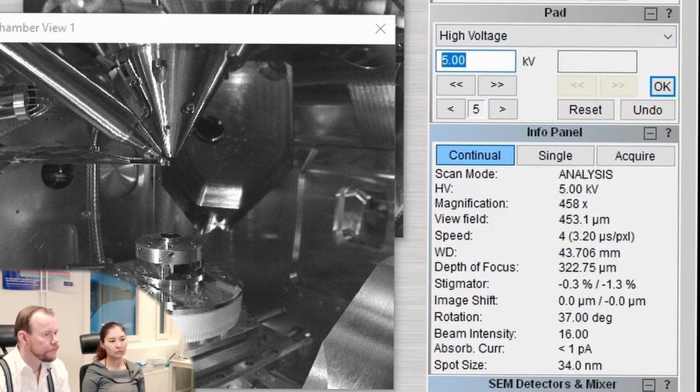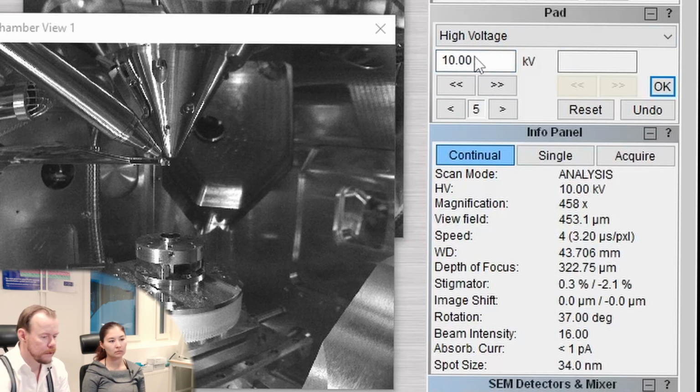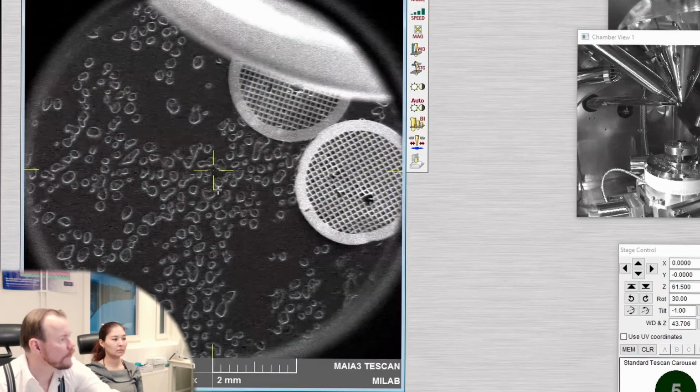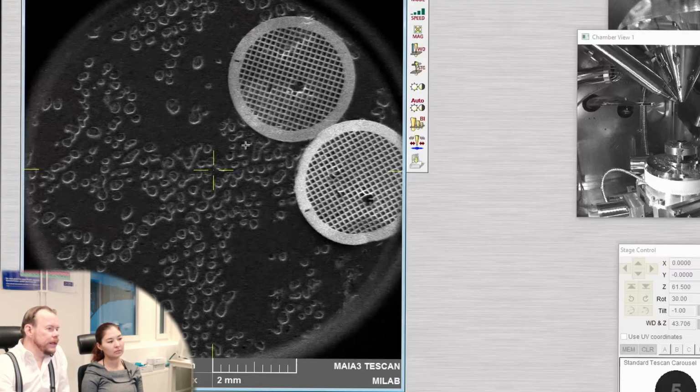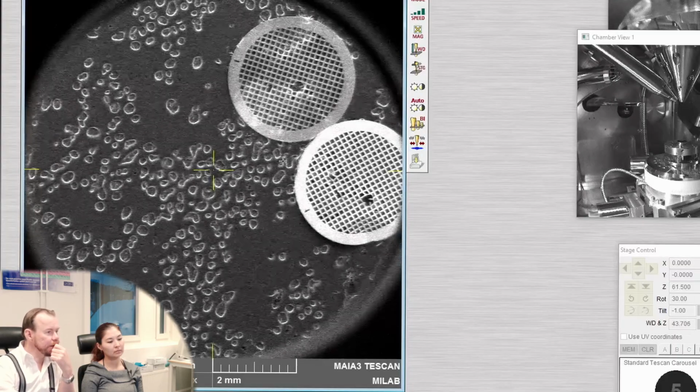We can go up in voltage to 20. I want to have 20. And now it is a little bit these gold nanoparticles. I'm not sure of the size of those, but I guess they are rather small. So it is a little bit of high resolution work, we can say. So here we see these two TEM grids, and we're running at 20 kilovolt.